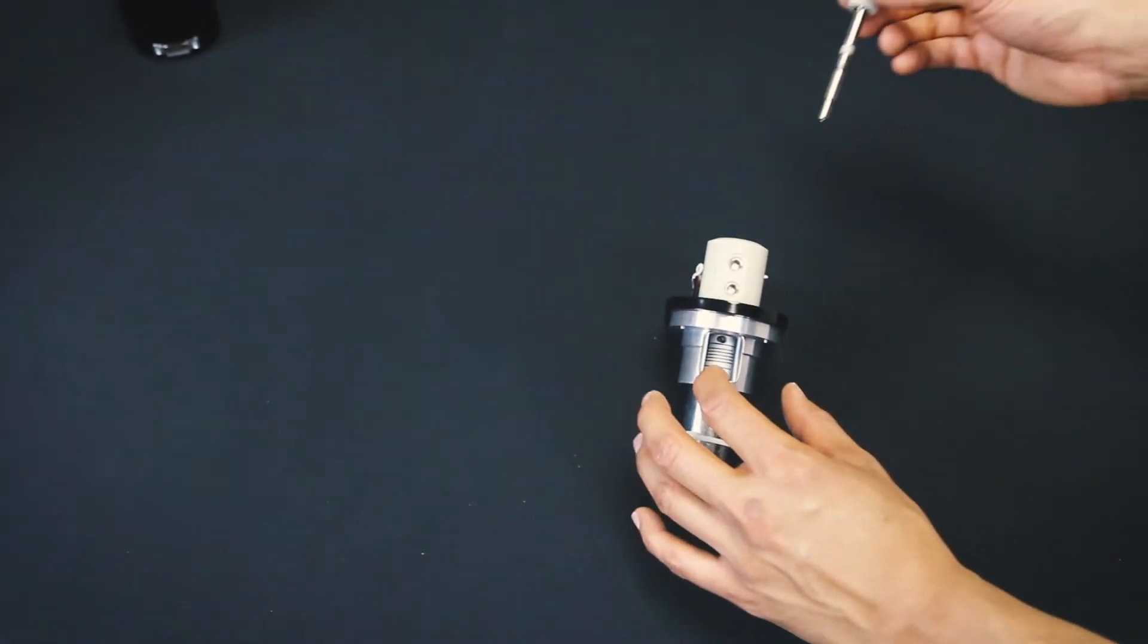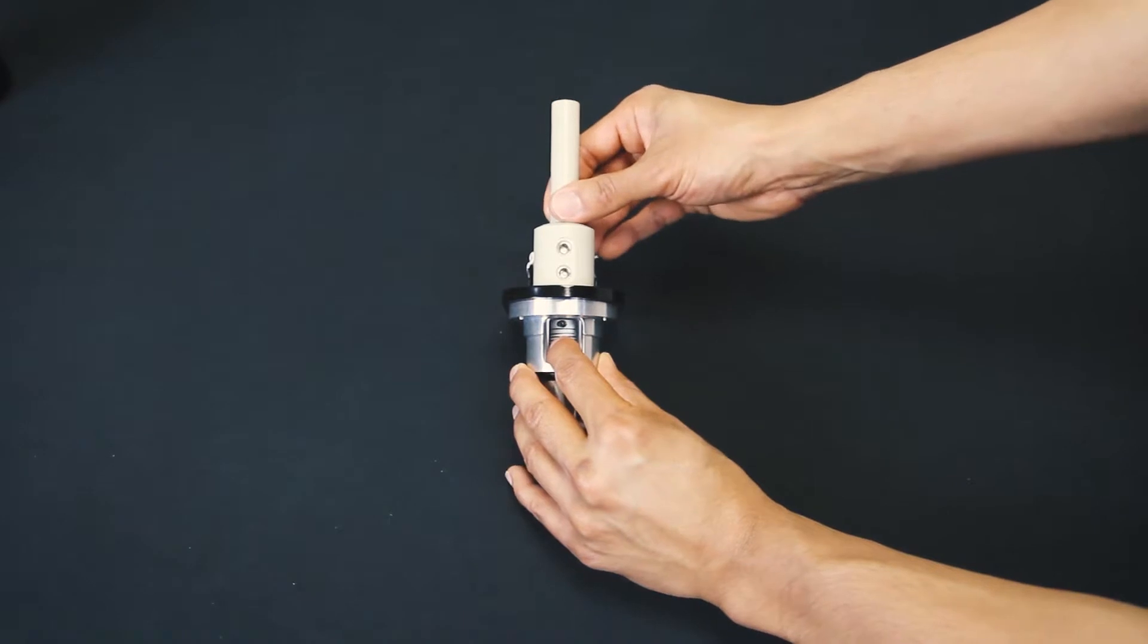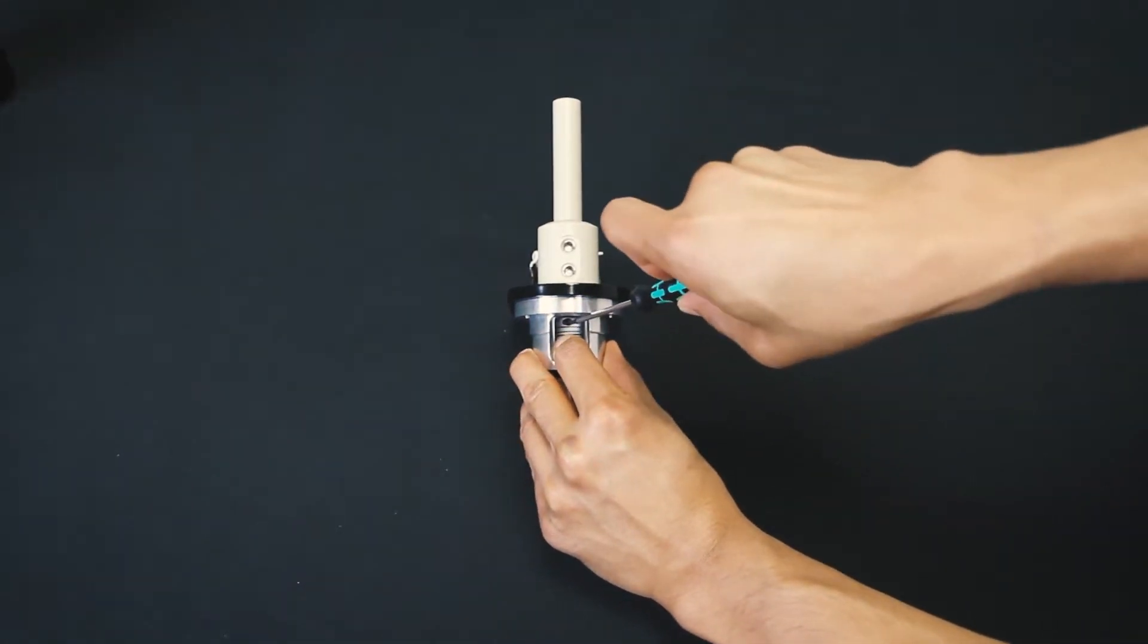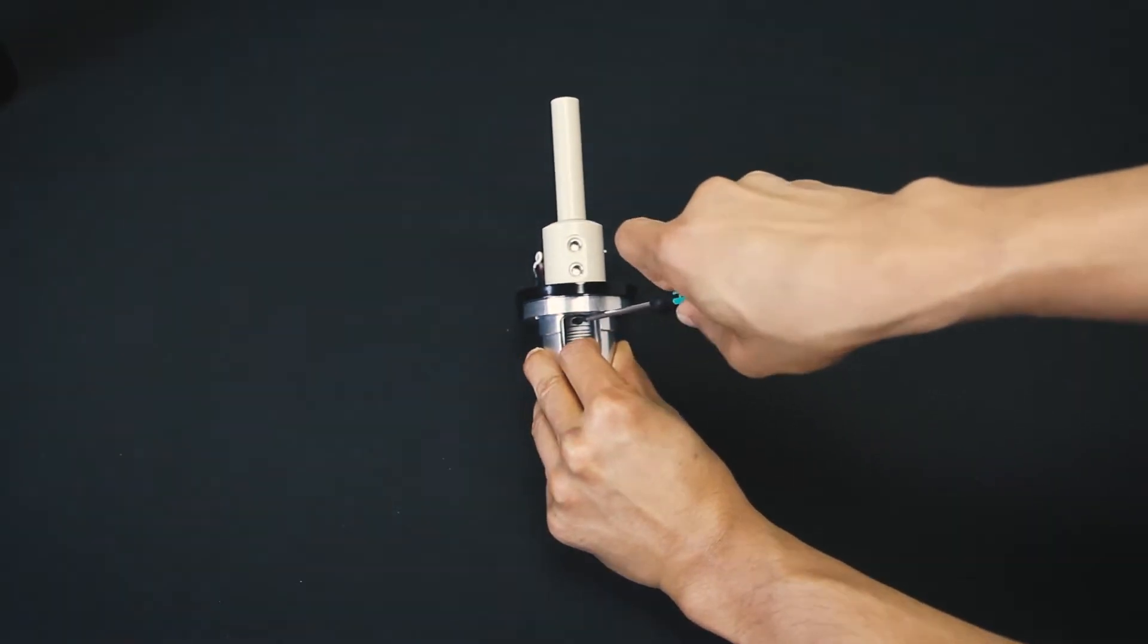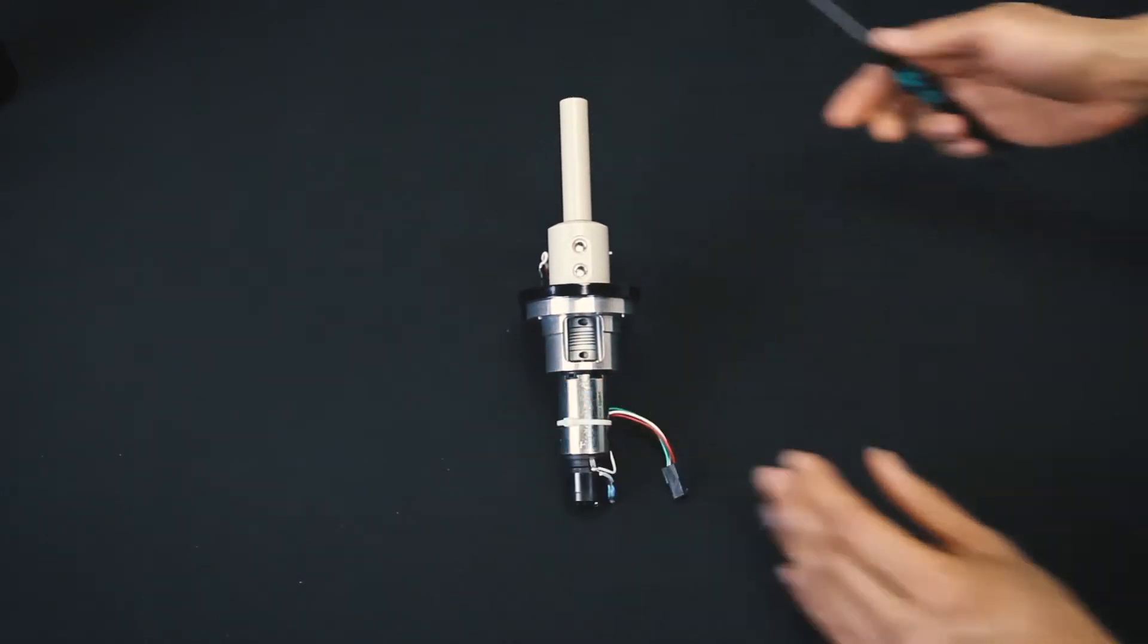Place the shaft into the bearing assembly. It should easily slide in all the way. On the motor head coupling, tighten the hex screw with your 1-16th of an inch hex driver. This should be the hex screw closest to the shaft. Do not touch the other hex screw. The shaft should also spin freely.